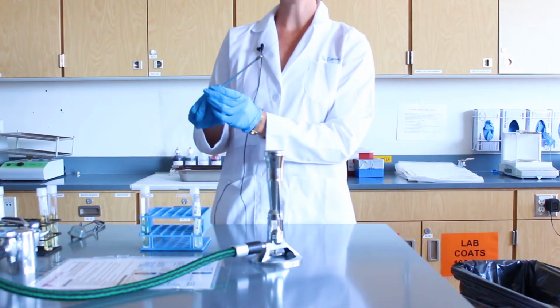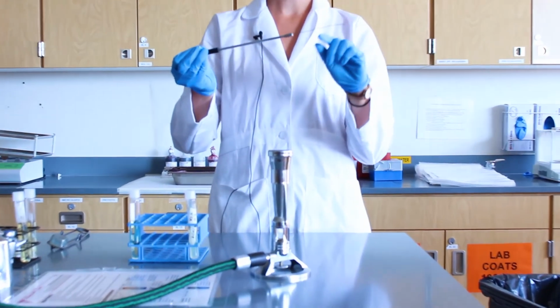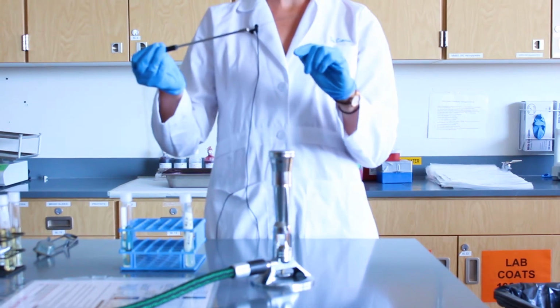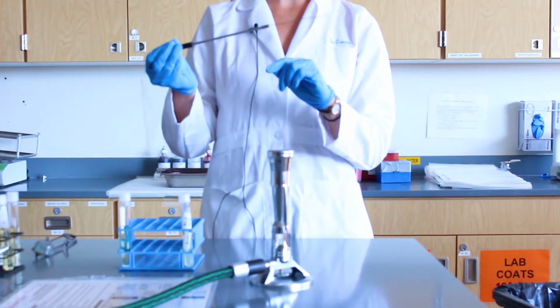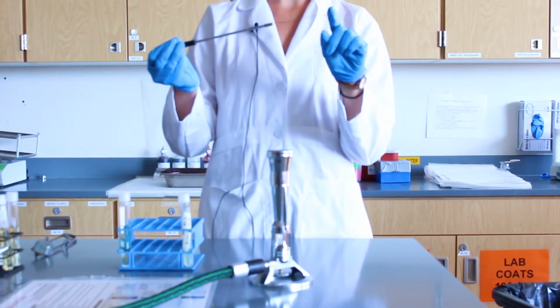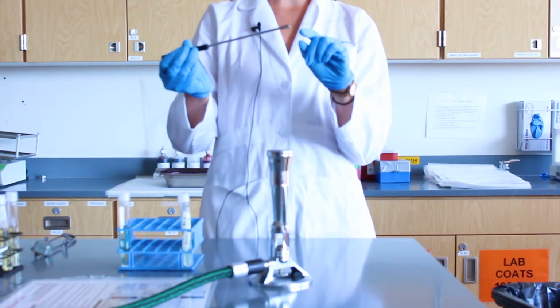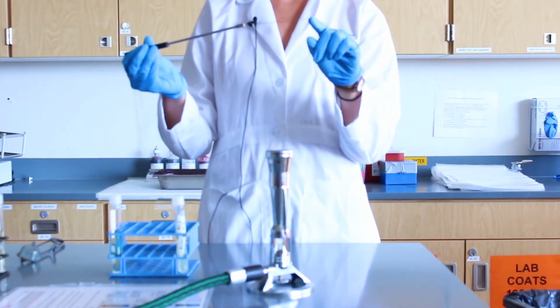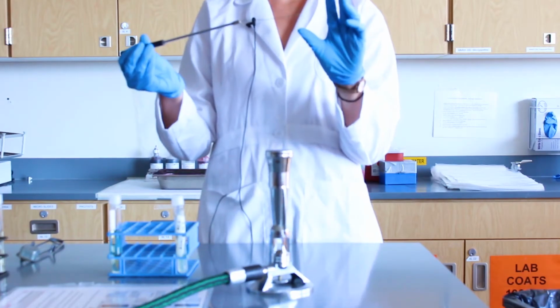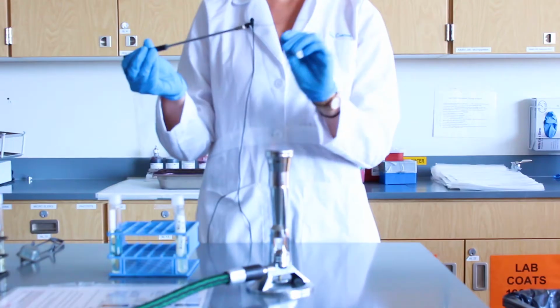When sterilizing your inoculation loop, begin from the base to the tip and gradually move it through the flame, making sure that each part of the loop turns red hot. It is important to move slowly, moving from the base to the tip, because most bacteria will be on the tip of the inoculating loop. This slow motion will reduce the amount of bacteria rupturing quickly when heated too quickly, causing bacteria-containing aerosols being released into the air.